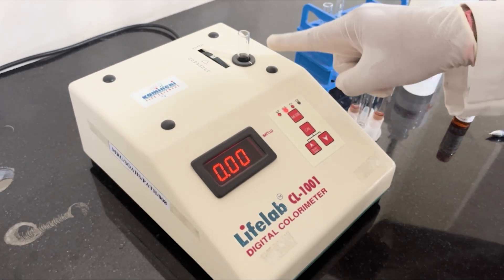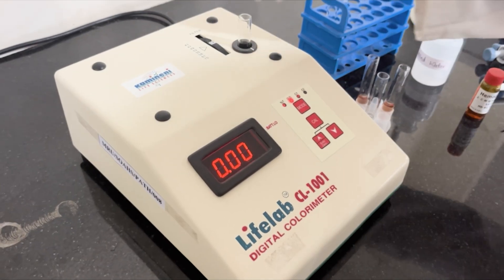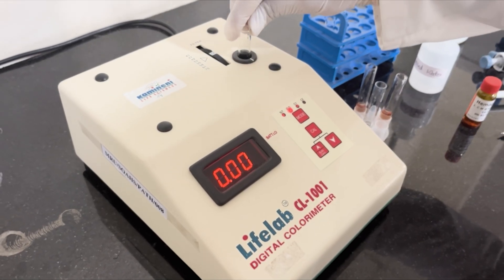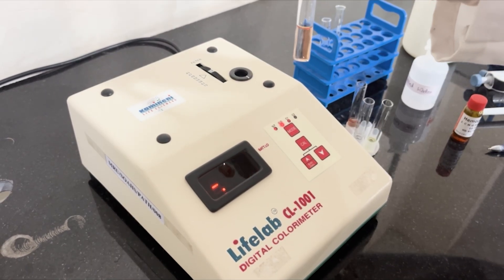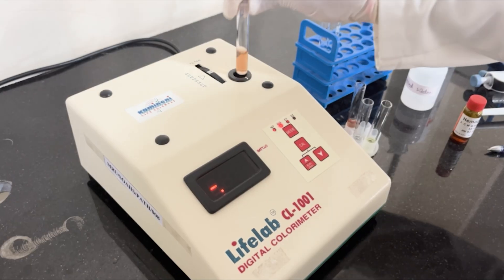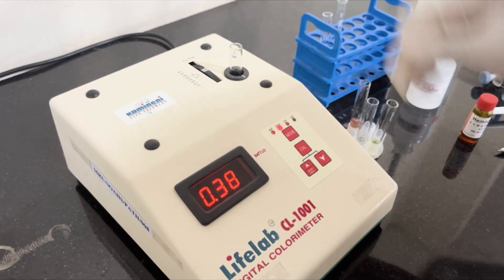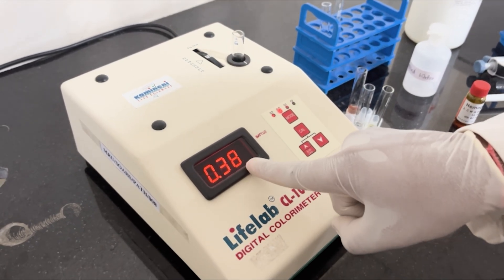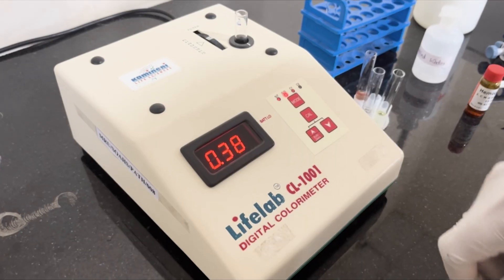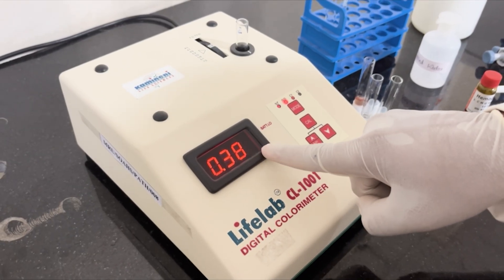Read the absorbance of the reagent blank — it is showing zero. Read the absorbance of the hemoglobin standard solution, and the reading is 0.38.